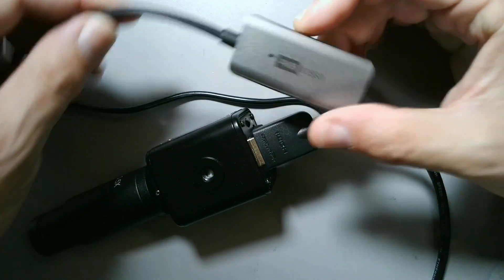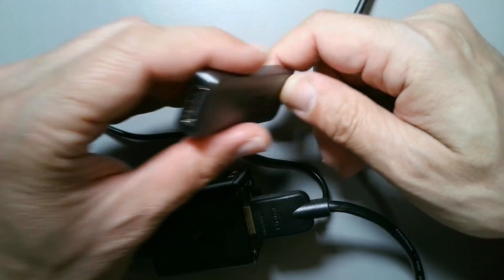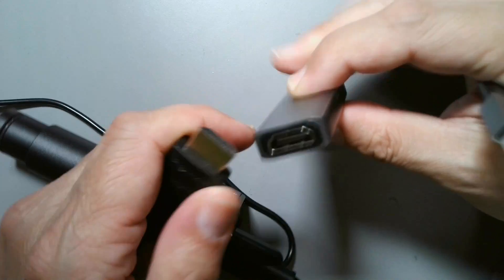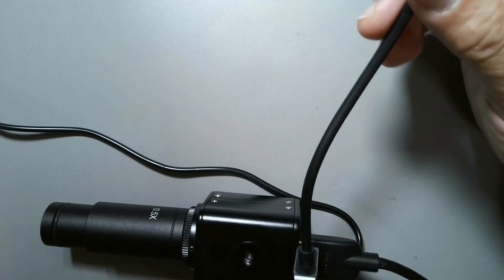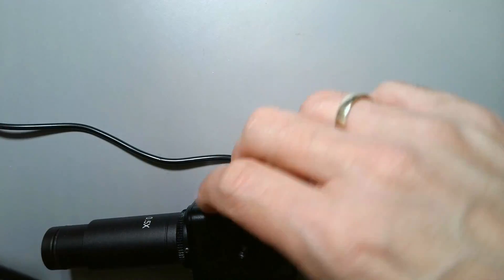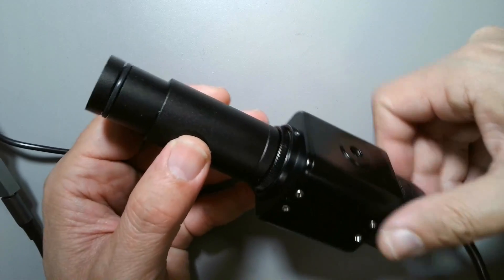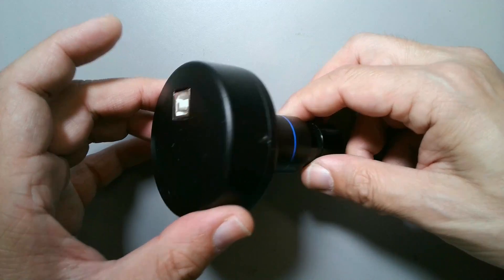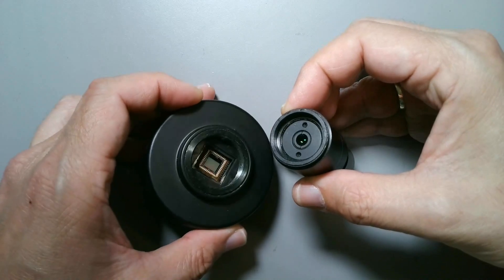I would like to feed the signal into my computer, so I also bought this HDMI-to-USB converter. It's USB 3.0 so it's fairly fast, and you can use it just like a regular camera. It's possible to use OBS Studio as well, or pretty much any software — you do not need any specific camera software to get the live feed. I'm also going to try comparing this with my old USB 2.0 camera to test which adapters are more suitable.